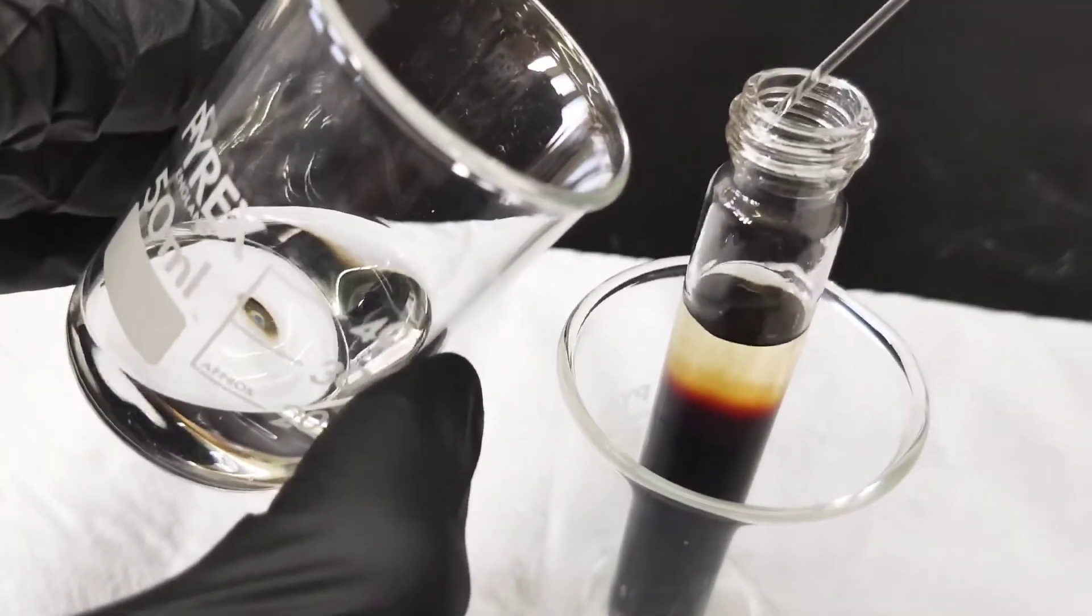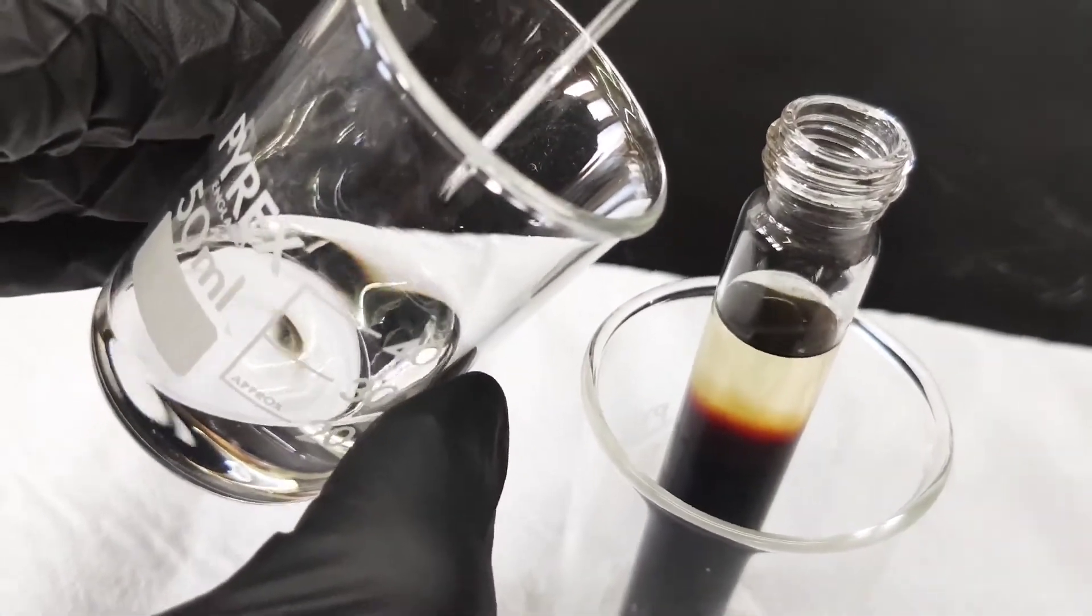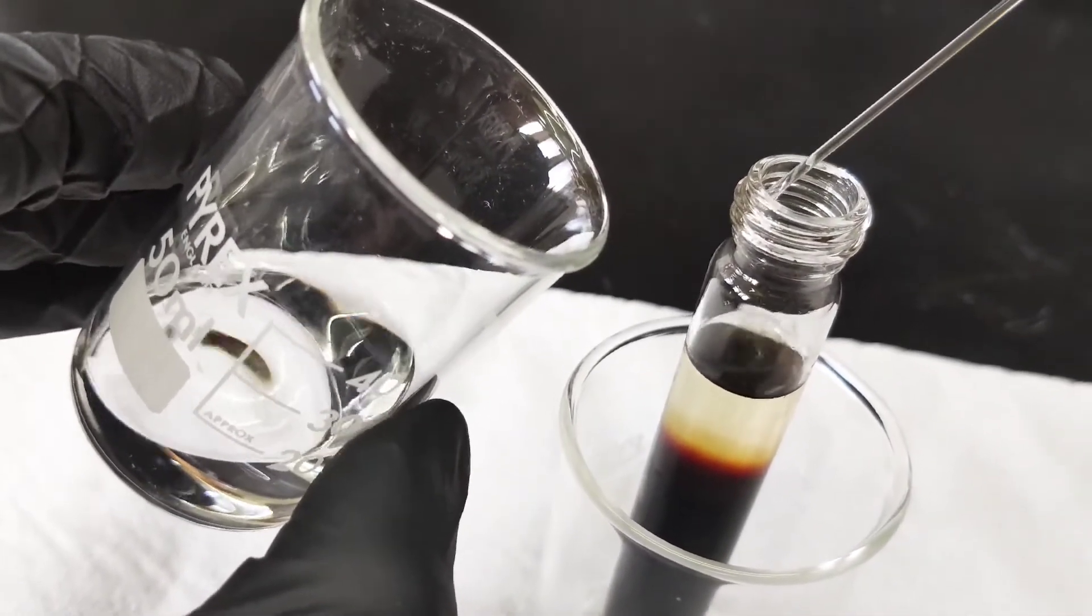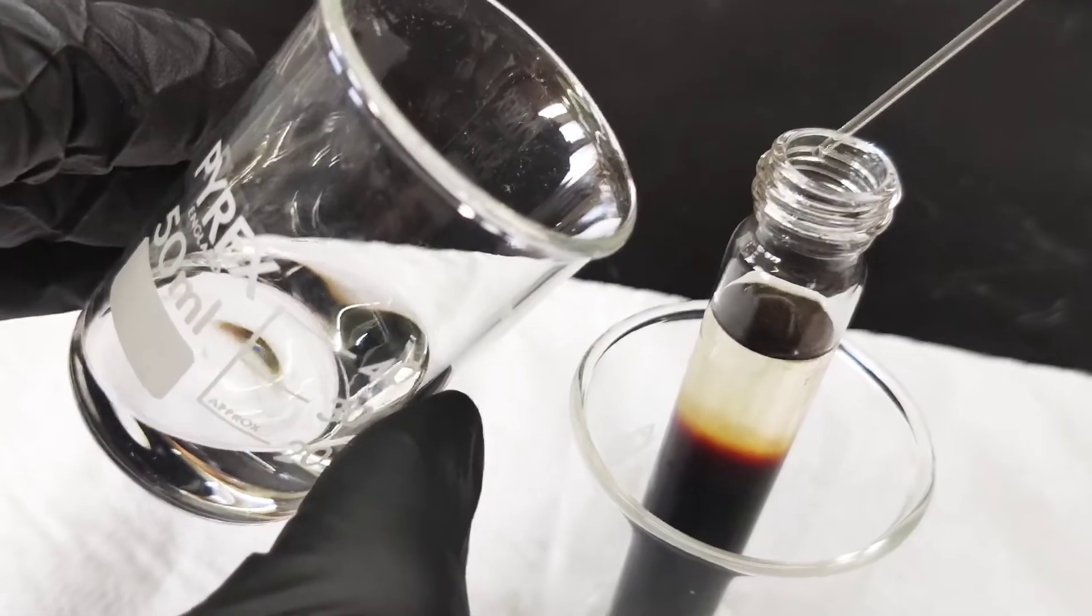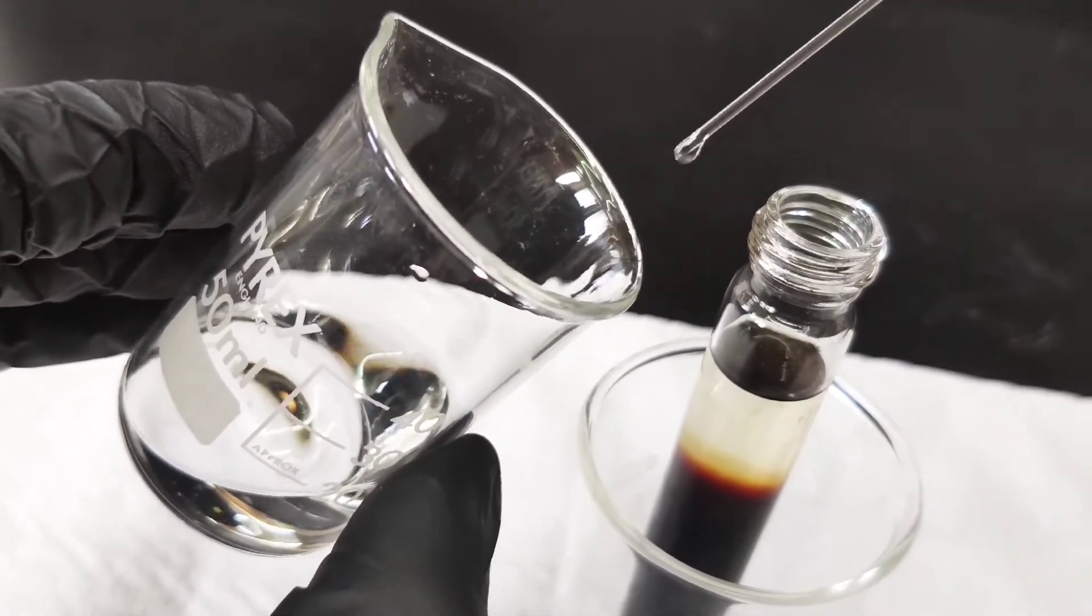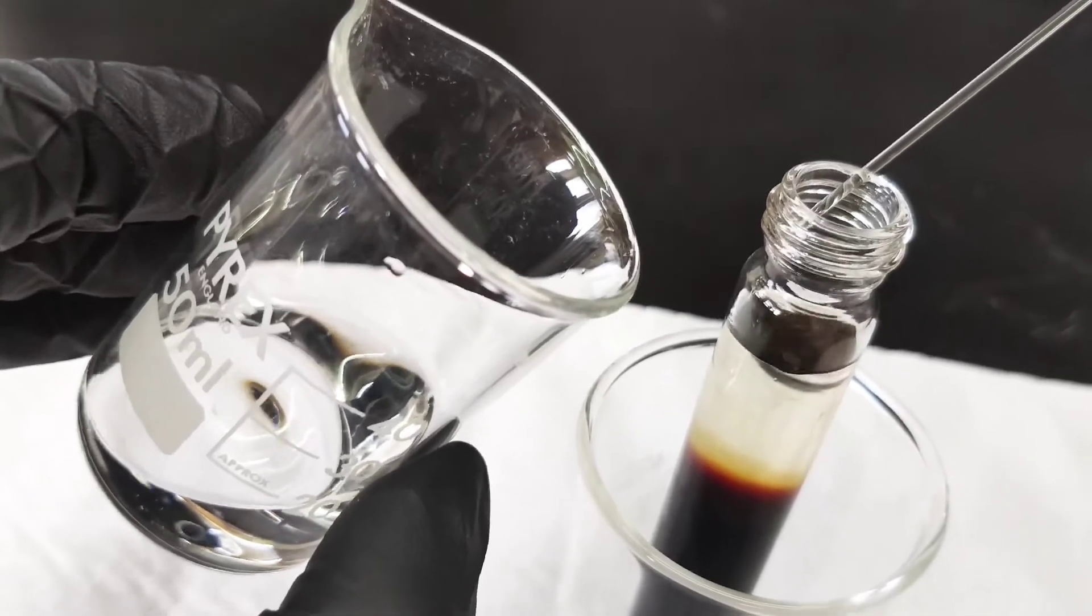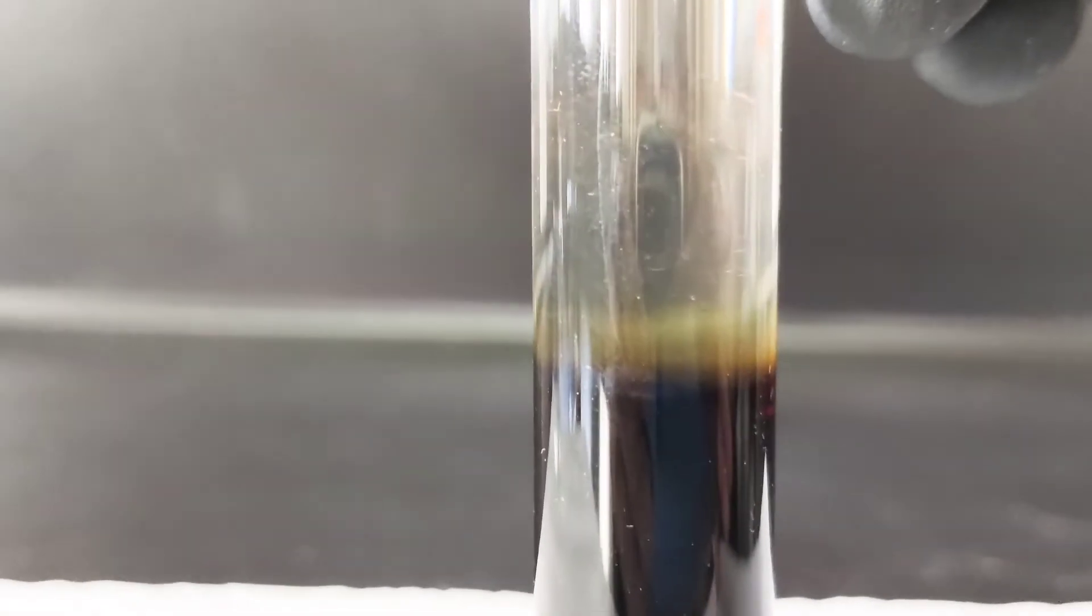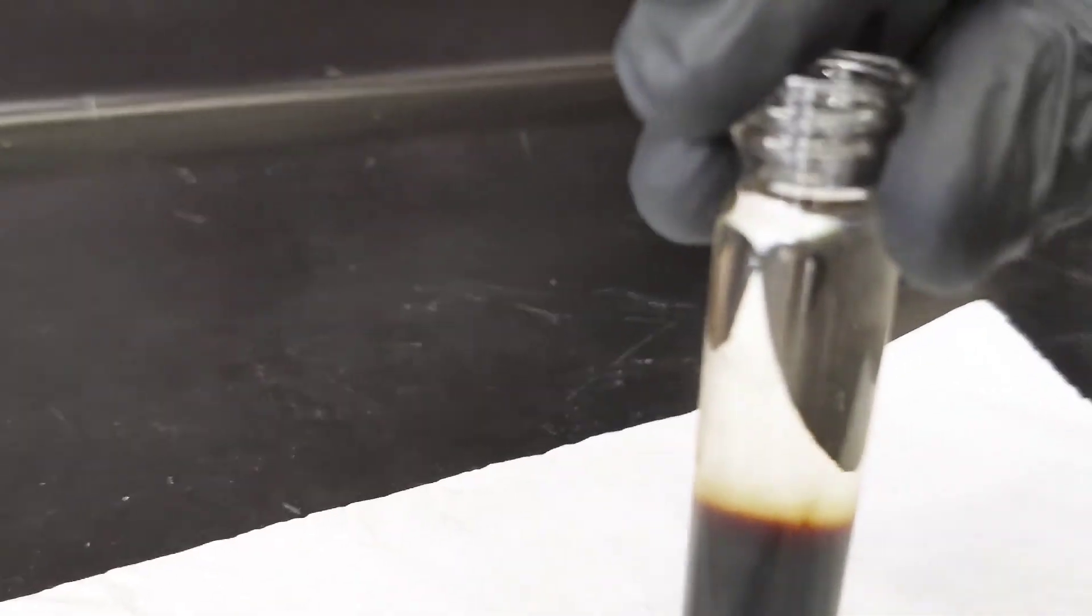We try not to perturb the DCM solution in order for the mixing to be very slow between the two solvents, thus achieving hopefully very nice and large crystals that can be used for x-ray diffraction. We are going to leave this in a quiet and dark place for a few days and hope for some nice crystals.